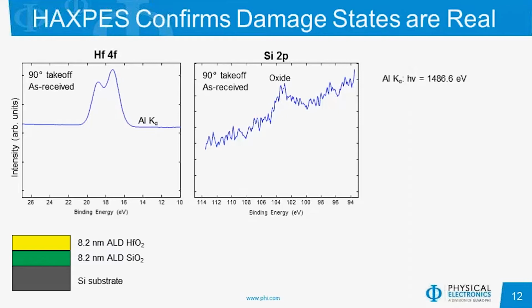So for the stack that we have, which is approximately 16 nanometers, if we tilt our sample to 90-degree takeoff, so we should get the most information from the bulk of the sample, using our aluminum K-alpha source, our hafnium 4f peak is shown on the left. As far as the silicon 2p, we only see one peak at approximately 103 eV, which would correspond to that of an oxide. So it appears that we are only seeing into the SiO2 layer and not all the way down to the substrate.